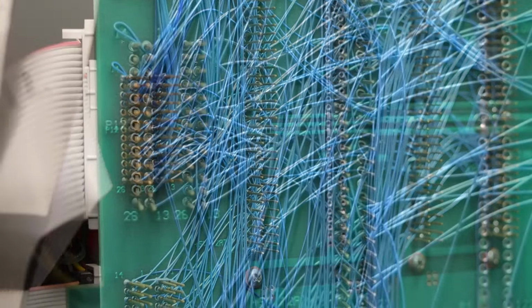But no matter what, it has to be coming from P2 down here on the bottom. This is the only place on the backplane that power comes in. So we have some kind of broken connection between P2 down here and J11 way up here. So let's just start tracing it backwards.